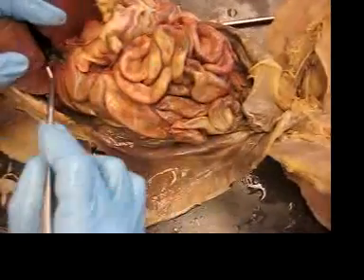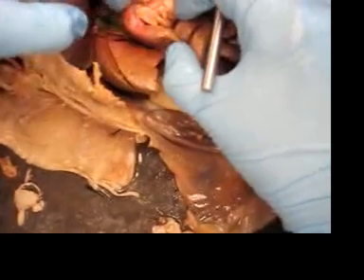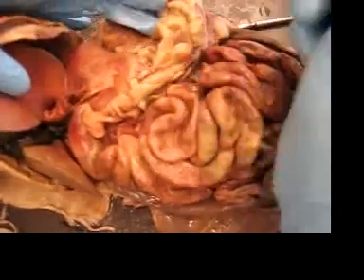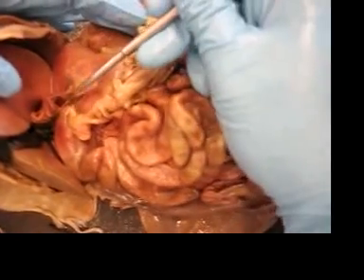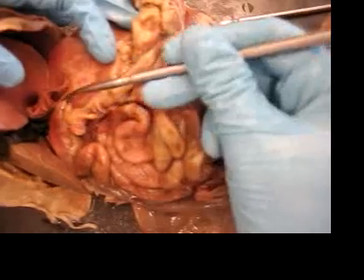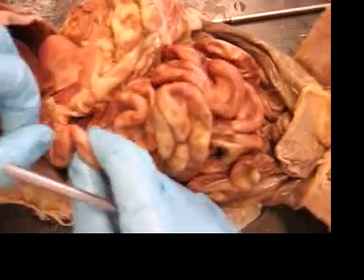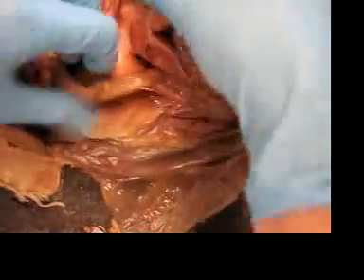You can see where the duct goes into the duodenum right here. The stomach is all of this, and right here is the pyloric sphincter, which separates the stomach and the duodenum. The duodenum is just the first part of the small intestine, and it goes around.